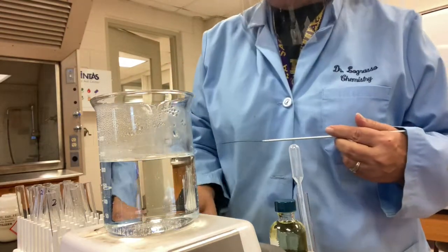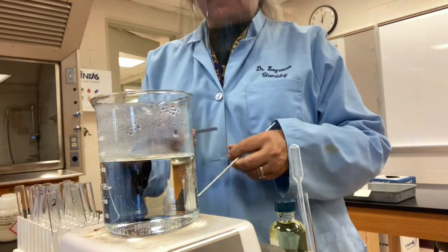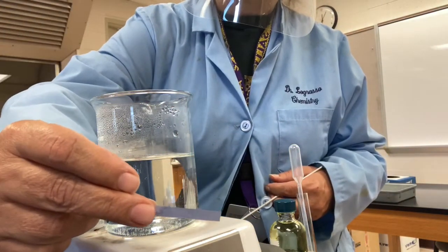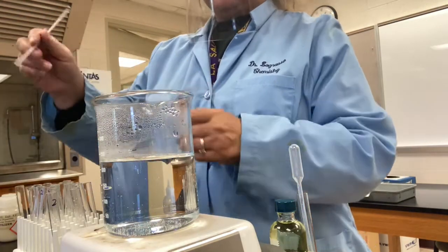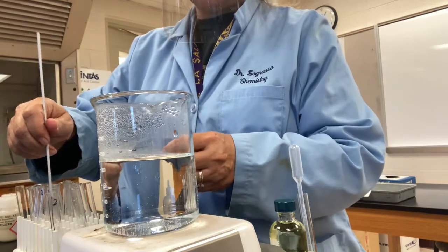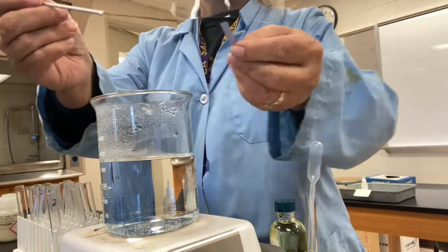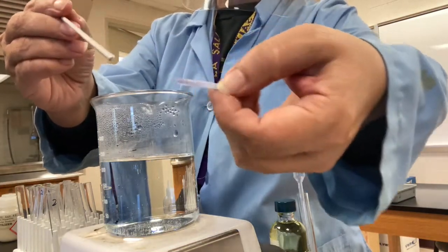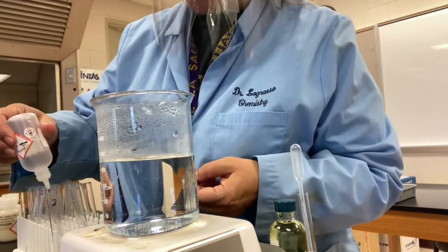So when we test for bases, we test to see red litmus paper turn blue. We did that already. Now we're testing for acidic, so we're going to take blue litmus paper and make it turn red. So testing before I add any nitric. This is the phosphate. I touch some of the solution. Do this side of it a little bit better. And I see that the paper's not changing color, so I add a few drops of nitric acid.